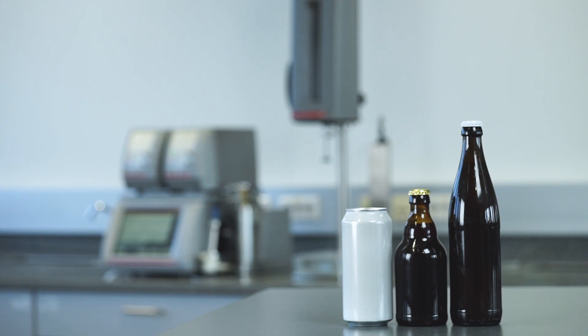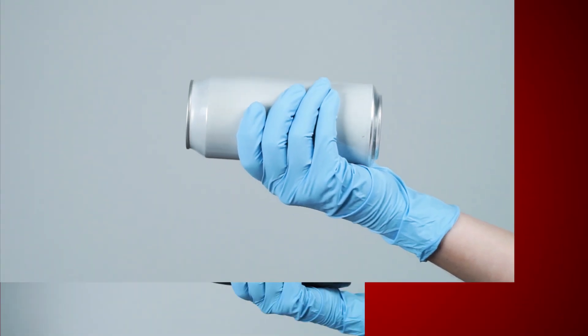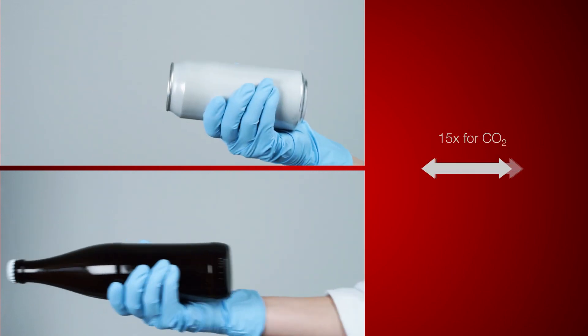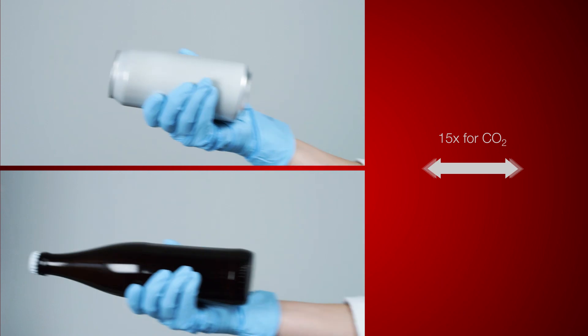Please prepare your sample for transfer. To do so, shake your sample horizontally for about 15 times to properly establish equilibrium between the CO2 content of the headspace and the liquid.